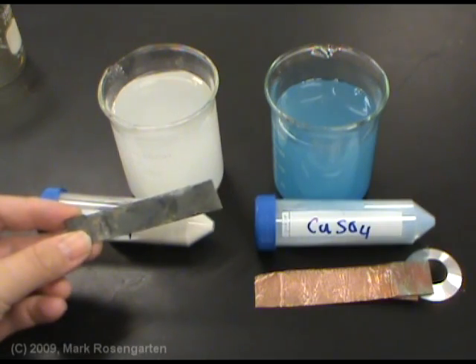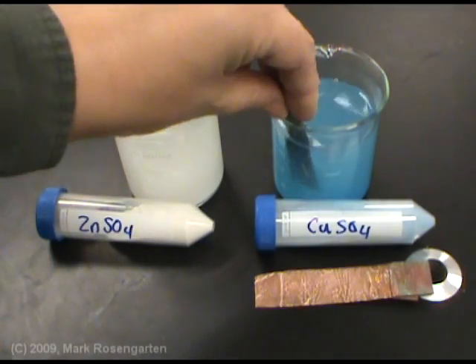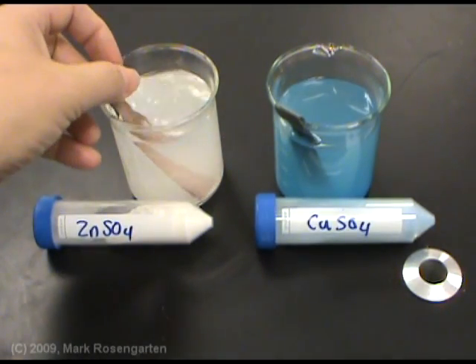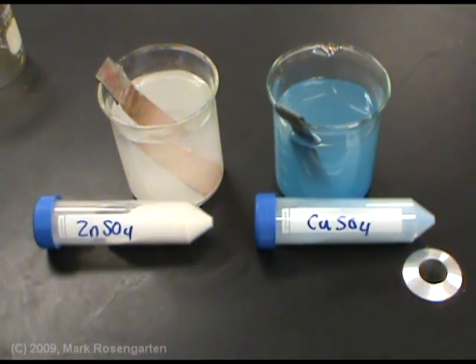I'm going to place a strip of zinc metal into the copper sulfate solution, and the strip of copper into the zinc sulfate solution, and wait and see what happens.